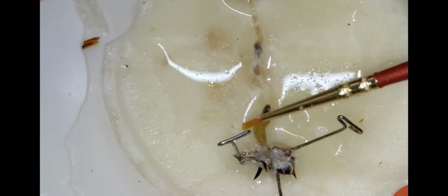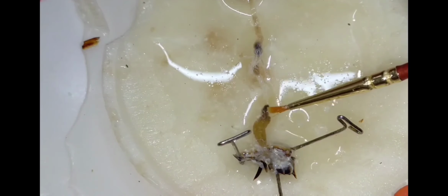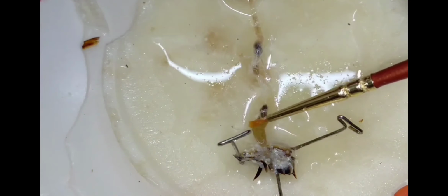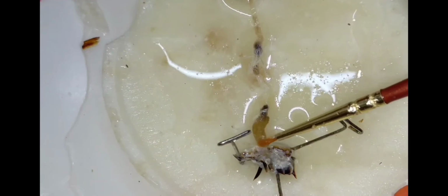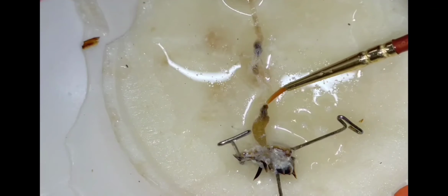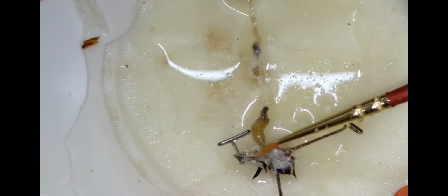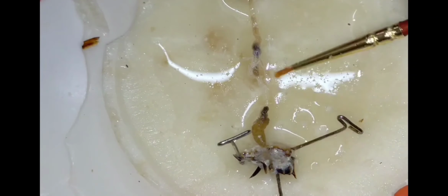Now, after the Malpighian tubules comes the ileum, and a small black sac-like structure. You can see it again, it's large. This is the colon. Then the ileum is this black one, you can observe it clearly. These are the ileum, and this is the colon. And after the colon, the rectum is present.